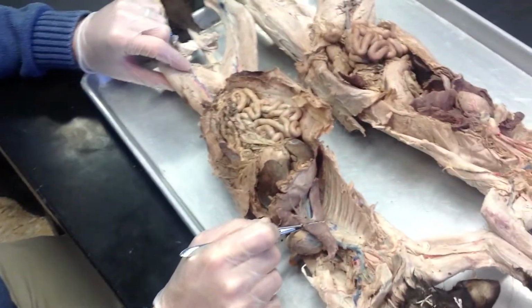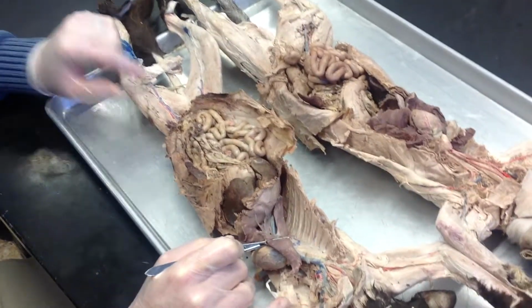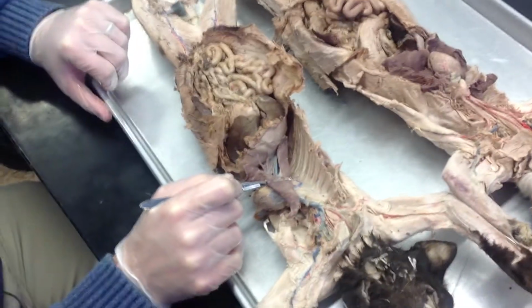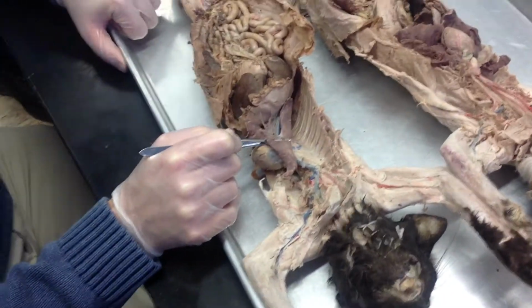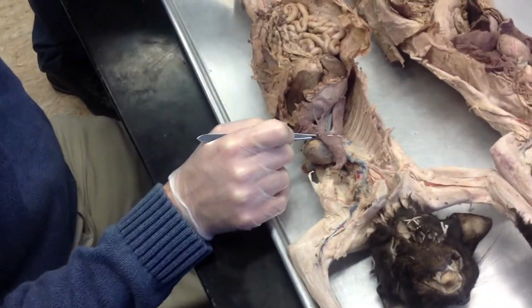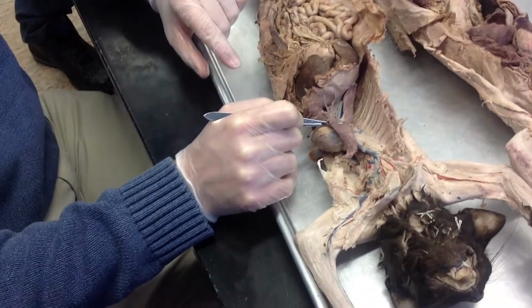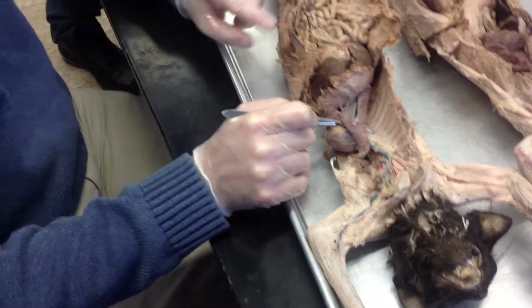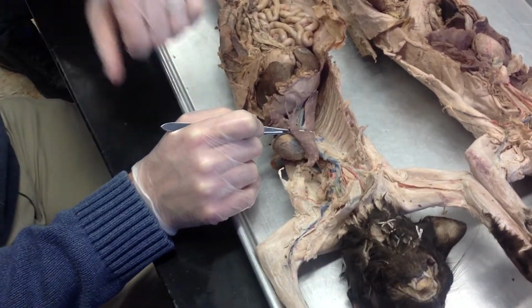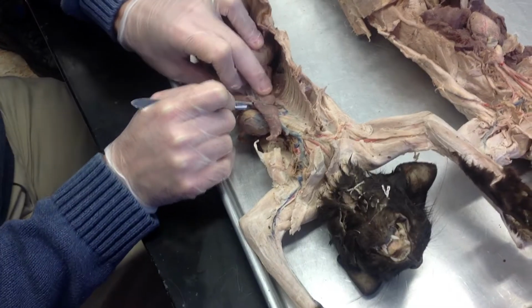It's called the azygos vein. It's an alternate route back from the inferior sections of the body. So personally, I wouldn't have put it on your list. It's actually really cool. Fish have this vein. You had it as an embryo, but then you reworked it a little bit. So it has a really neat history and embryological stuff, so it's a cool vein to know. But it's the only vein that's not on our list of brain and back, hand and back, foot and back. It's an alternate route back from the inferior parts of your body, the azygos.